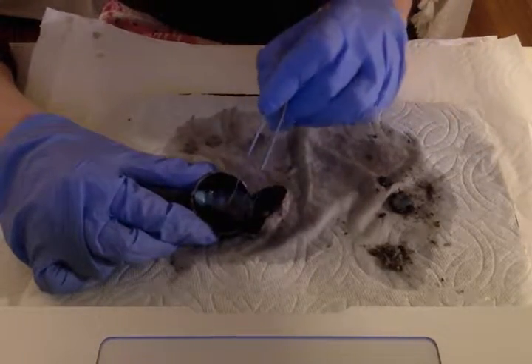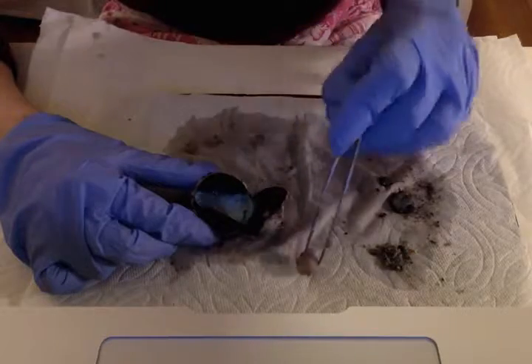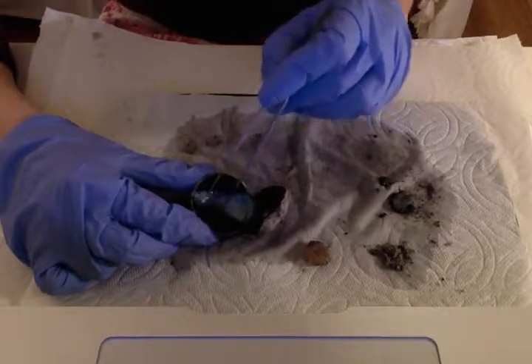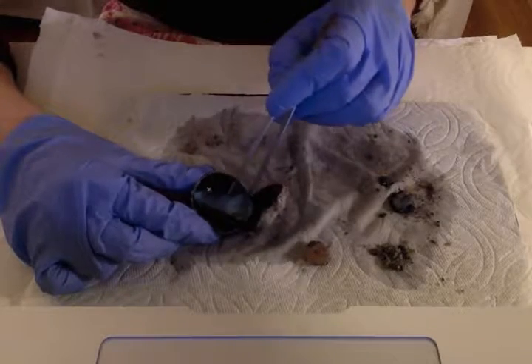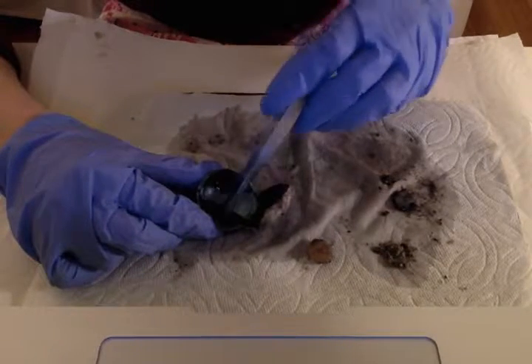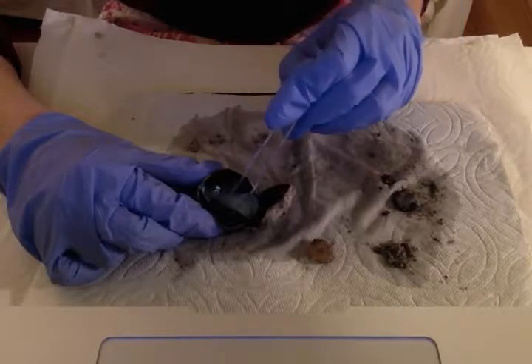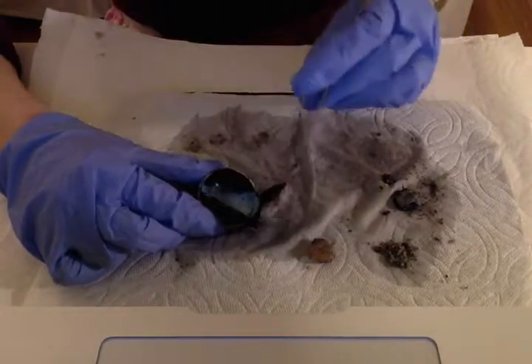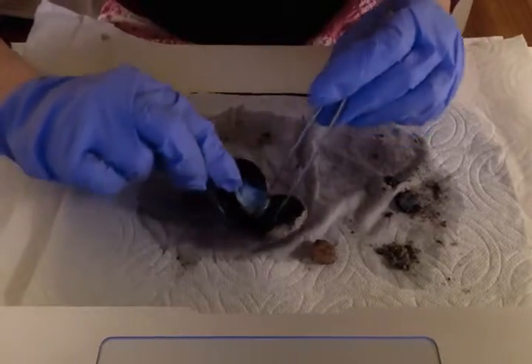And so the choroid is actually, I'm going to move the lens out right now, this shiny, pearly blue layer right here that you can see a bit of. And if we pull this back, then we can see the sclera right there. It's interesting. Okay, last things I want to show you.